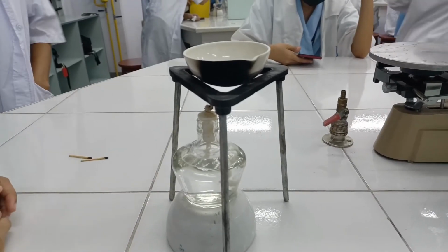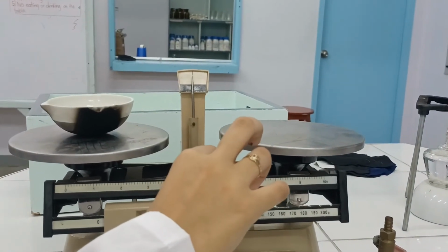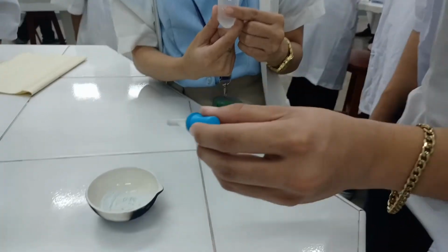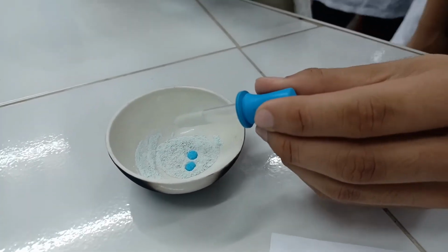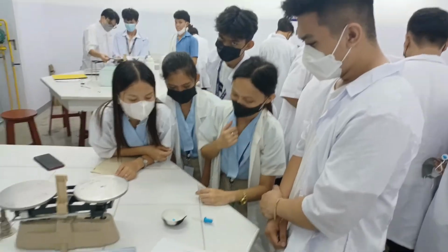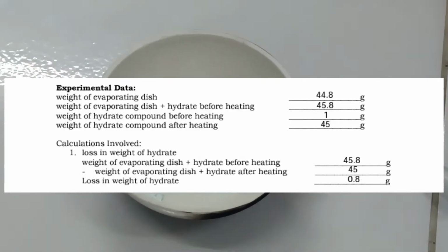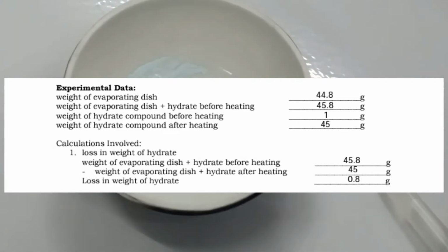Allow the evaporating dish and its content to cool, then weigh and record the weight. After weighing, put 3 to 5 drops of water onto the substance left after heating. Then record your observation. And now, presented on your screen are the experimental data that we gathered during our experimentation.